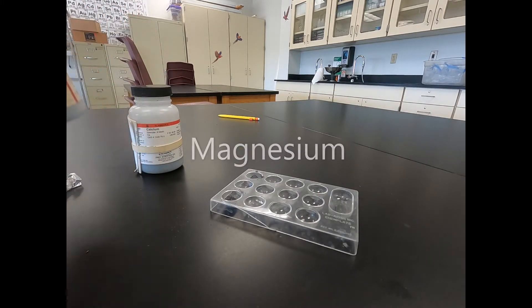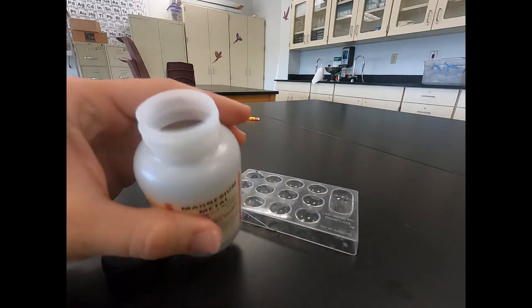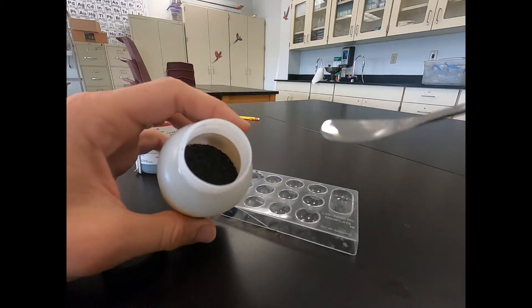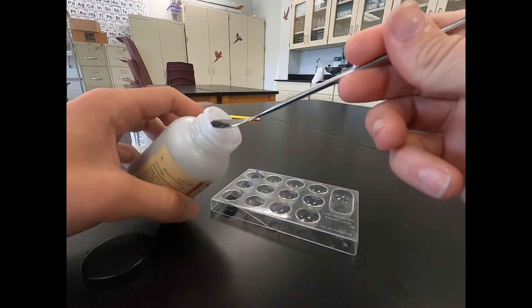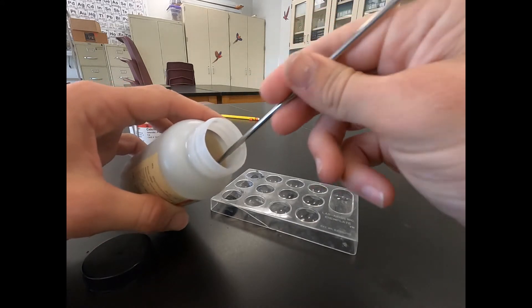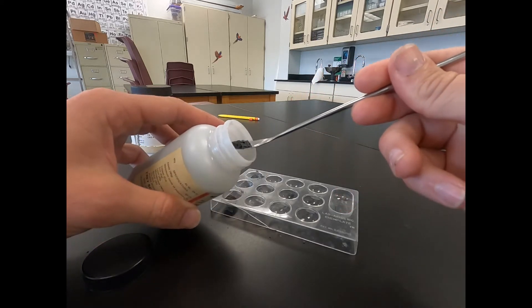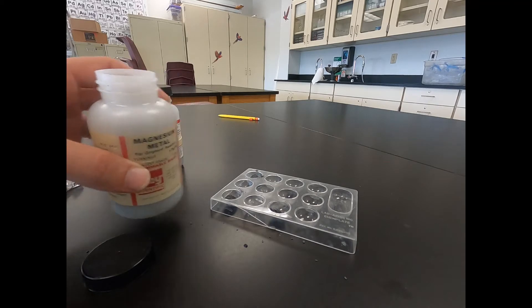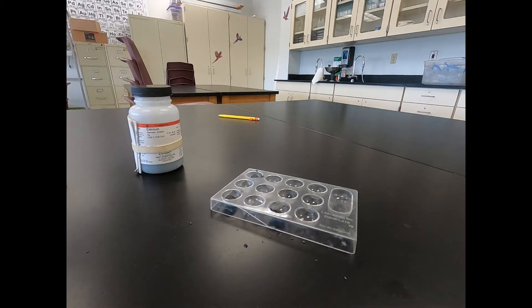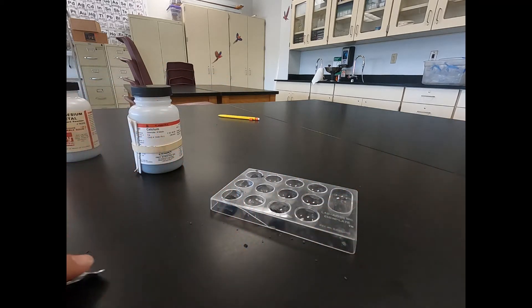Next we'll use magnesium. We'll do a little powdered magnesium today — we could use magnesium strip as well. We've got a new spatula here and we'll put our magnesium over it, a little bit on top and some more on the bottom. Finally, we have aluminum. For the aluminum, we're just going to use aluminum foil and we're just going to break it up into two pieces and put one on top and one on the bottom.